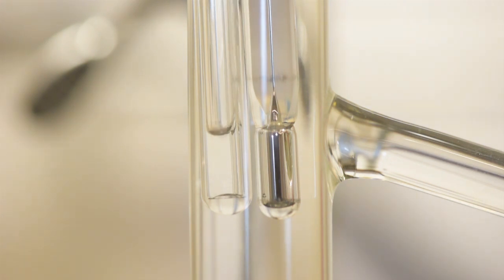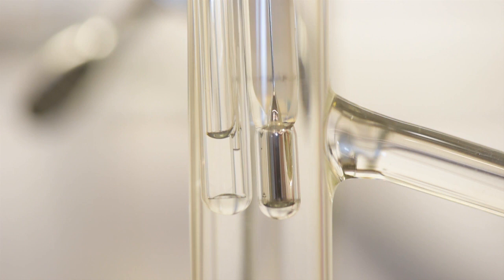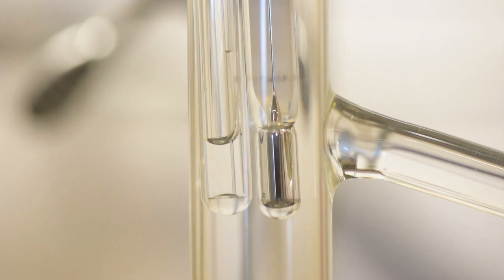Continue watching the bell tube so that you may record the temperature at which you first observe the liquid going up the bell tube. The system has now cooled back down to the boiling point, so the sample vapor inside the bell tube is condensing back into a liquid. Because the condensed liquid phase has more than 100 times smaller volume than the gas phase, the huge decrease in volume creates a vacuum suction in the bell tube that pulls up the sample liquid to fill the void and equalize the pressure. Once you have recorded this temperature, wait until the temperature falls a few degrees below.